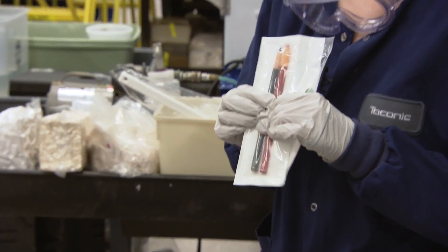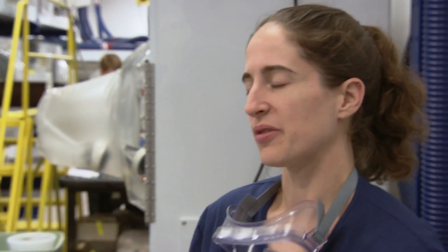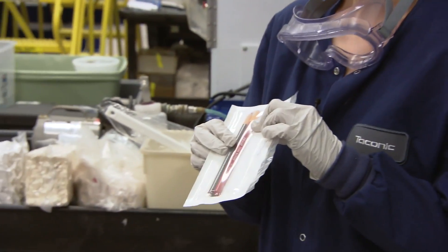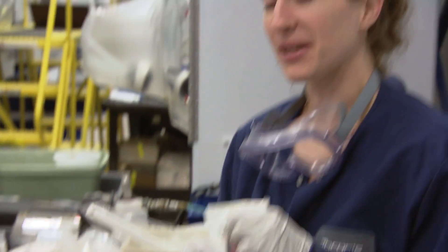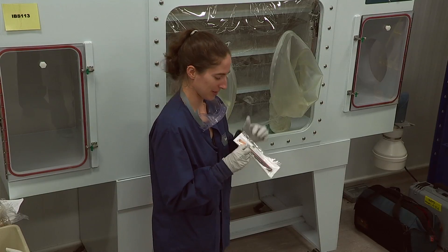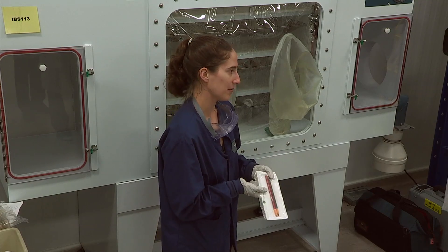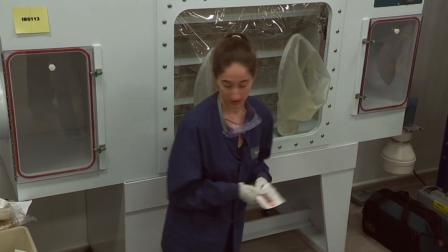One caveat if you're keeping things germ-free is these grease pens don't autoclave very well. They seem like they autoclave well, but when you go to unravel them to resharpen, they kind of fall apart — you're only going to get about that much use out of it. So we have these gassed, but they are great for that.